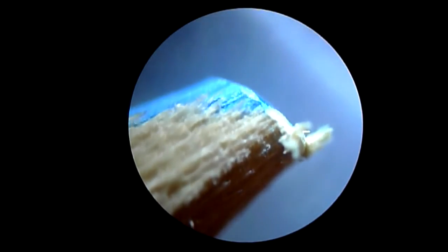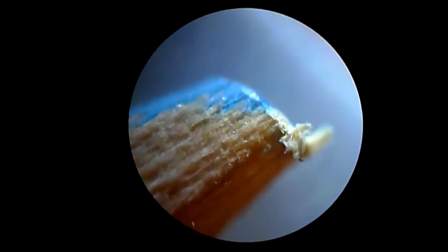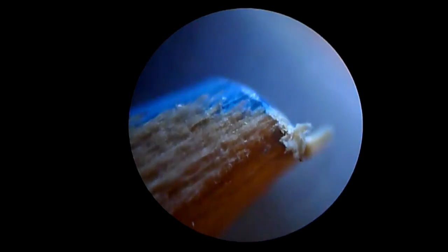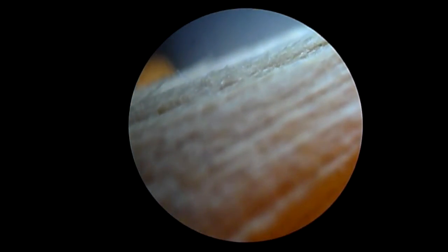That's 40, so you're looking at a pencil that's 40 times magnified. It's got excellent focus and control, and I'm just flashing an LED bike light around here. So that's the pencil tip. Very fine movement control on the stage, the microscope stage.